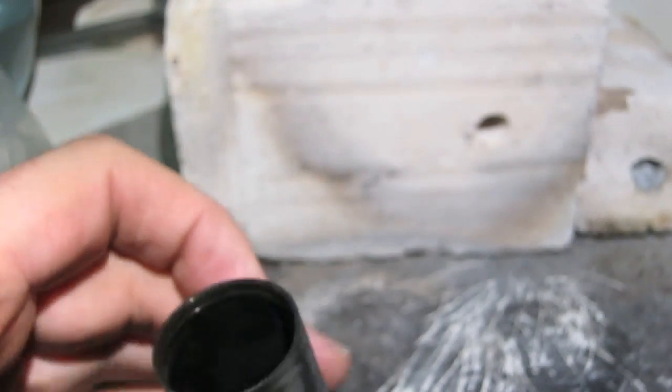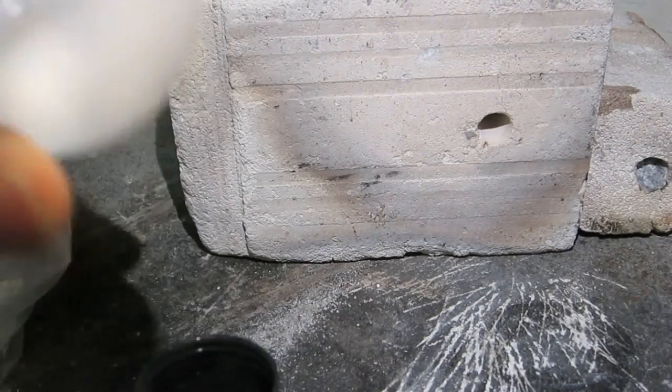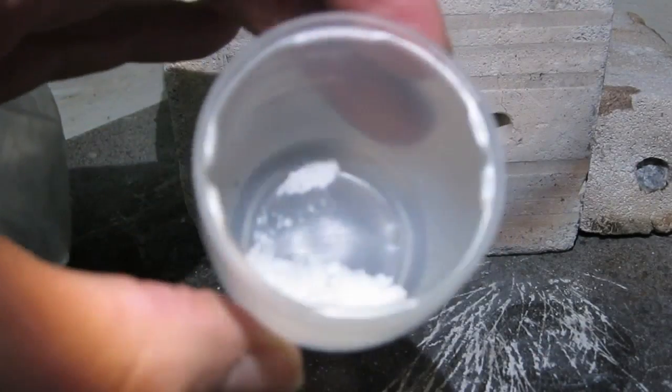Bromine. Ok, we are going to start here with making bromine. Bromine making from potassium bromide.